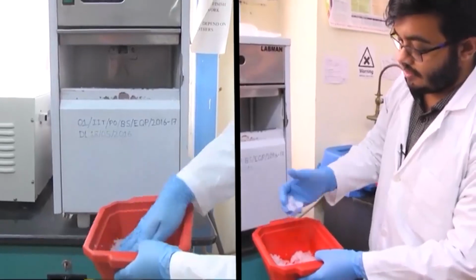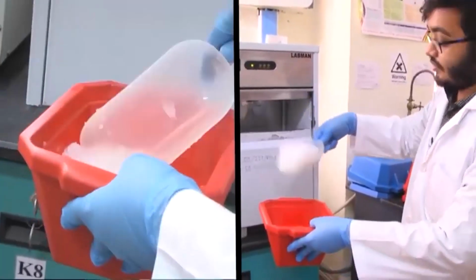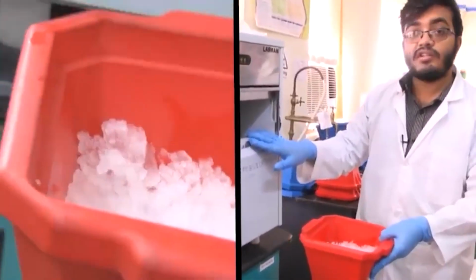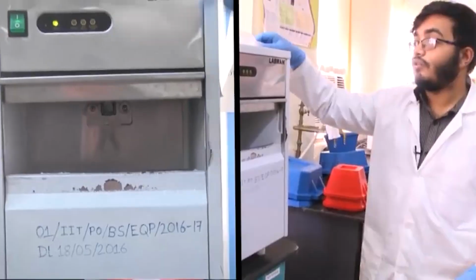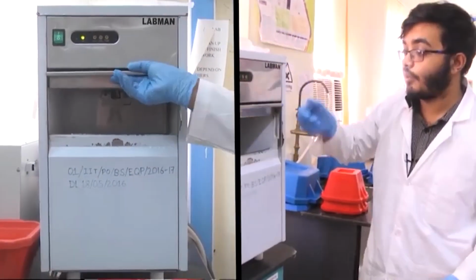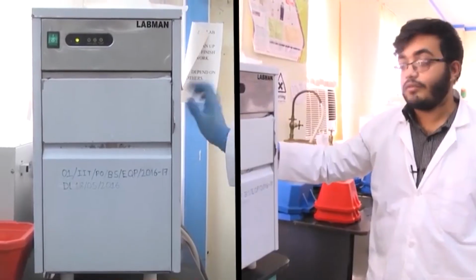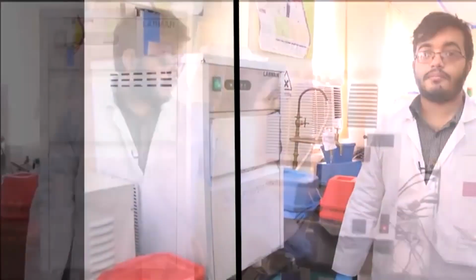So, flaked ice which we take inside these ice buckets, and so this is a very underappreciated but very essential component of the laboratory, because if you do not have ice cold conditions, many reactions will not work, and making ice cubes in normal refrigerators is laborious and time consuming and does not really suit the purpose. So, often it is quite essential to have ice flake machines which will take water supply directly from the tap, and they will convert it into flaked ice which you can then just take out and use.